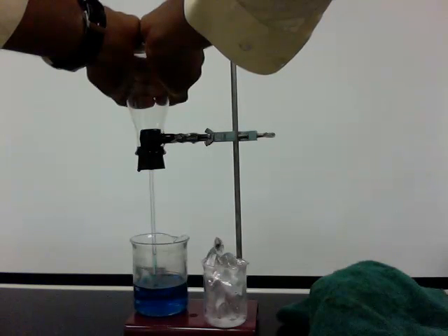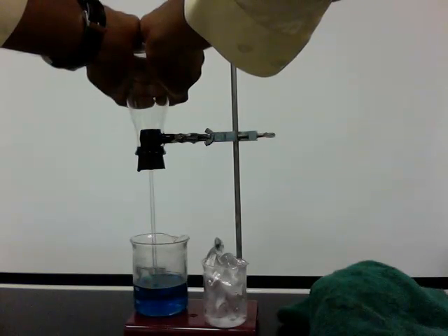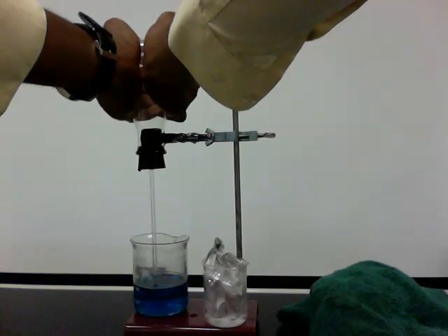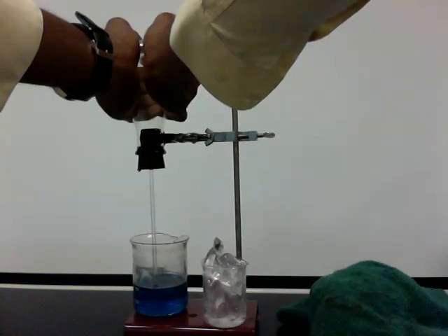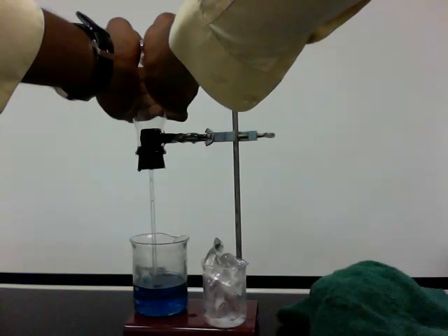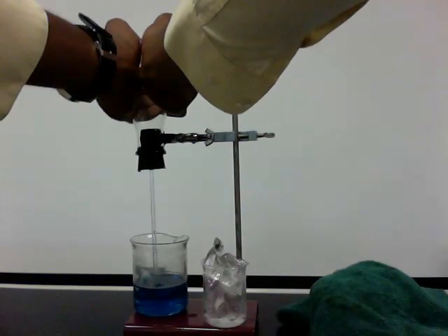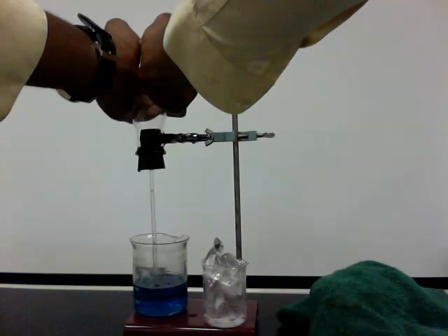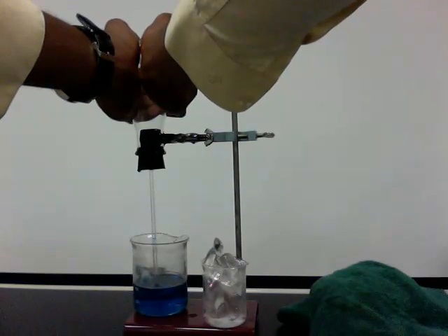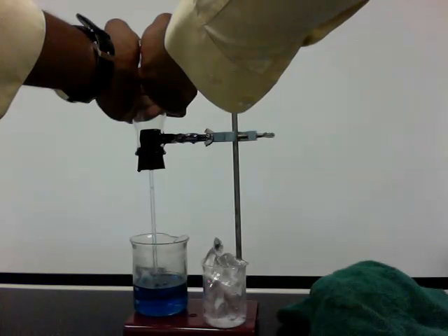The water is moving back down into the beaker, and we're actually getting a few bubbles. Think about what's happening with the molecules of air inside the flask and how that explains why we're getting bubbles in the beaker right now.